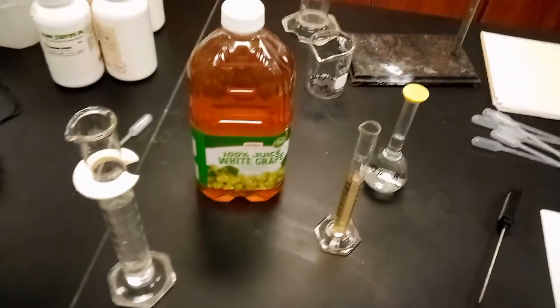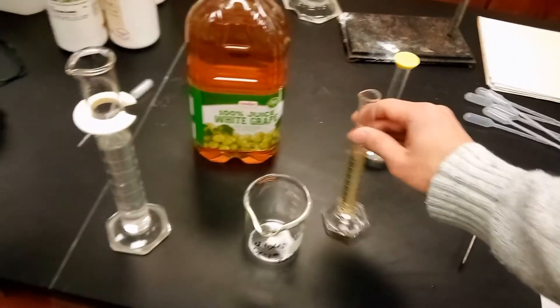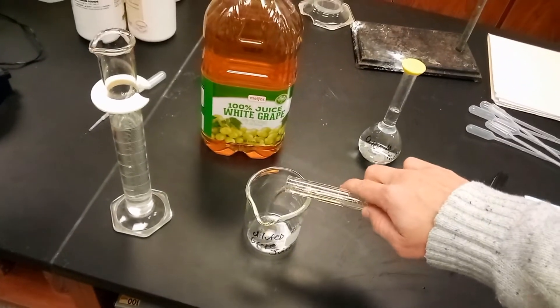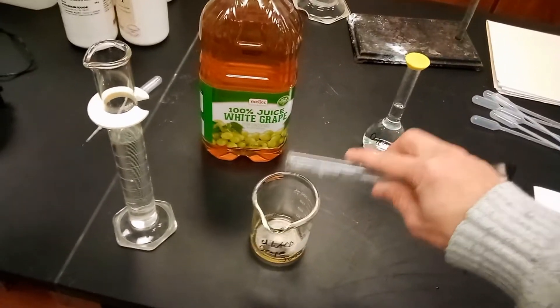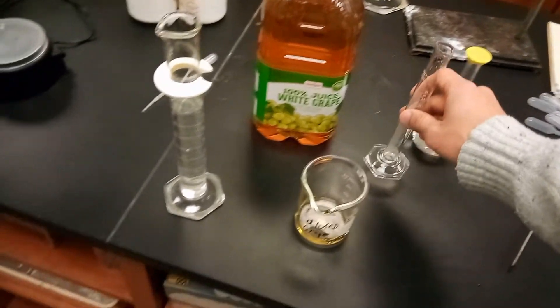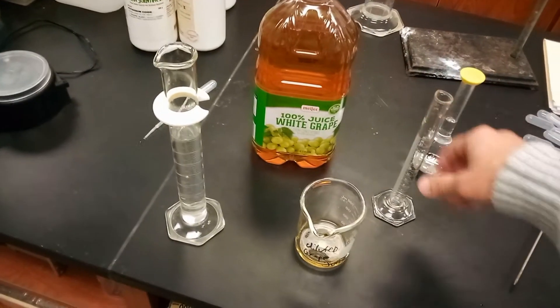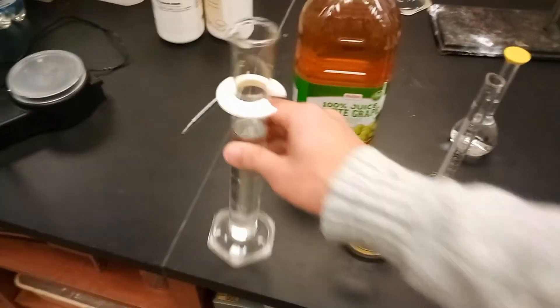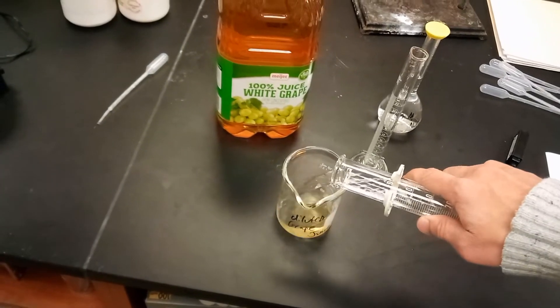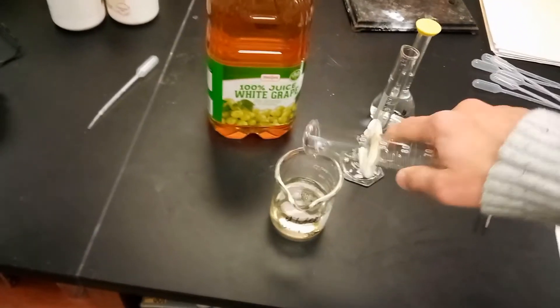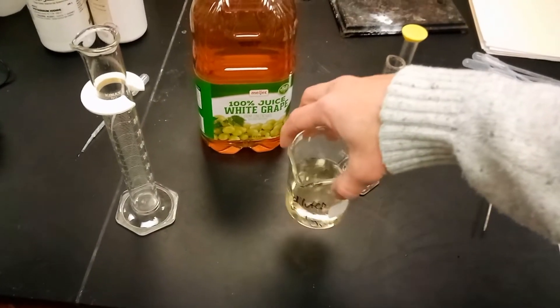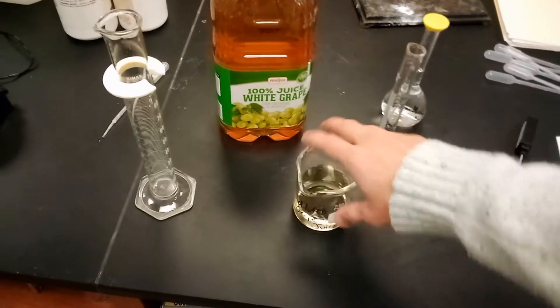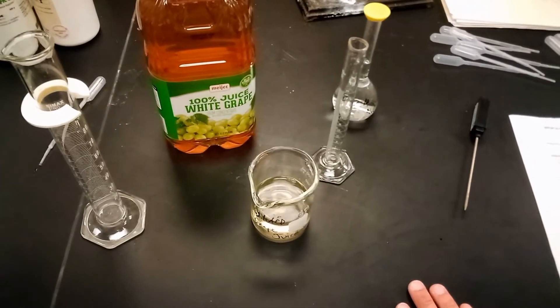What you need to do is take 25 milliliters of the white grape juice and add it to a beaker. Not 25, sorry, my bad. You need to take 20 milliliters of the grape juice and add 80 milliliters of pure distilled water. So we'll just dilute the grape juice, but it's enough grape juice so that we can actually put a pH probe and measure the values as the titration occurs.